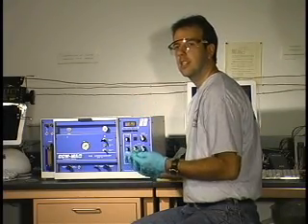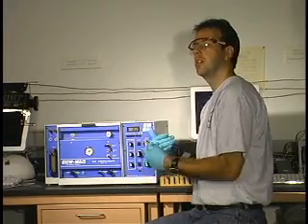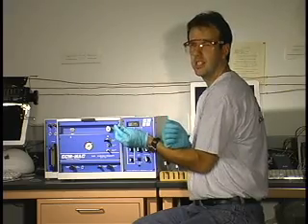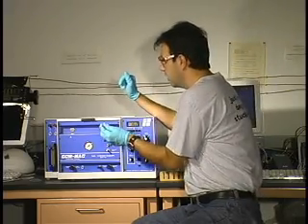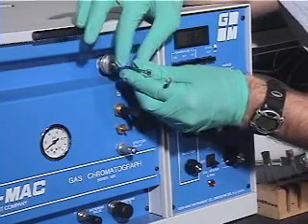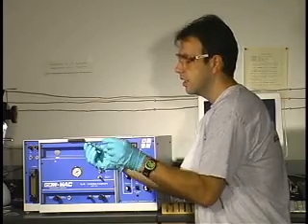When you're running the gas chromatogram and using the instrument, there are three sources of potential errors you may run into. The most common is that when you have your solution in your syringe and you're getting ready to inject it, students get a little excited and push the plunger in really fast. What happens is the plunger bends — this is a very thin piece of metal. There's no need to rush; you simply need to do a controlled motion.